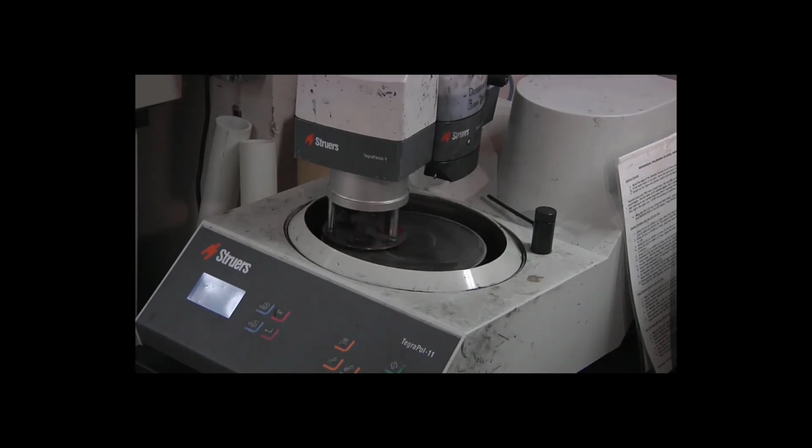And you need the surface to be flat to an order of magnitude better than the indent. So we need that 1 micron in order for the surface to actually be flat at that scale. Makes sense.